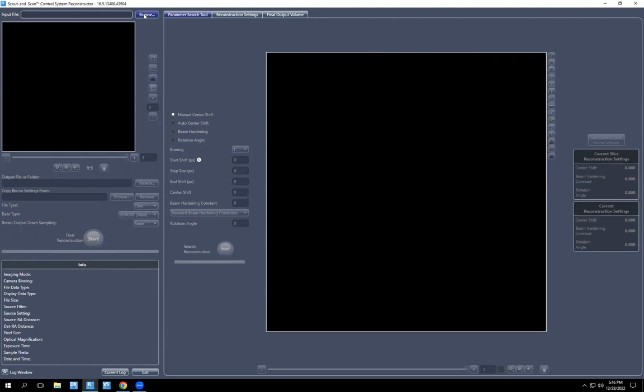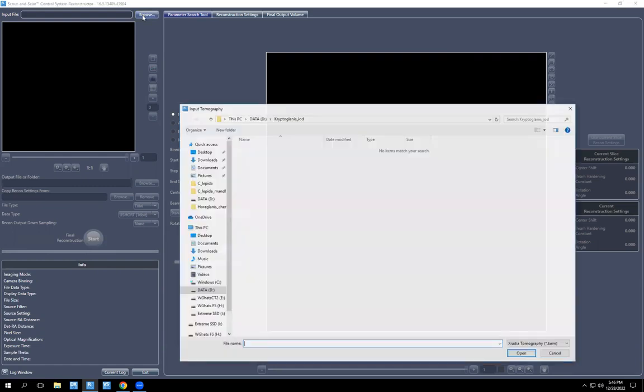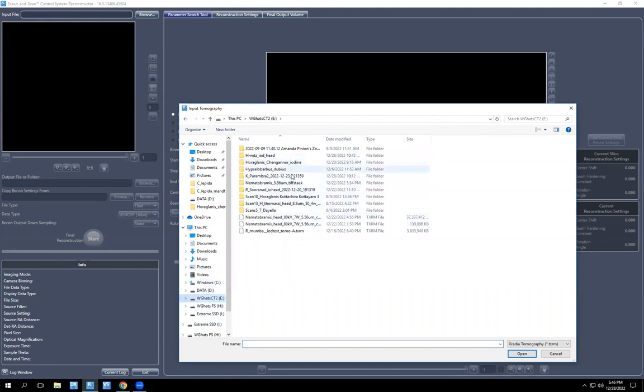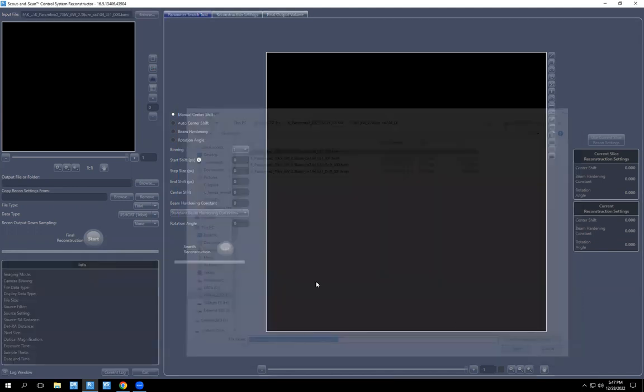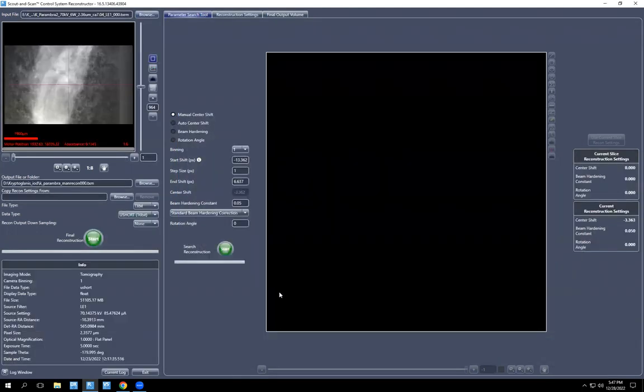So the data set I'm going to pull up is Kryptoglanis soft tissue scan, but it works the same with the skeletal scan. So browse for your input file. The first thing I'm going to do is open this segment because I already reconstructed it. And as you will see, you have to use the same byte scaling for every segment.